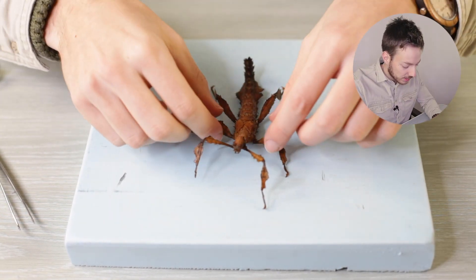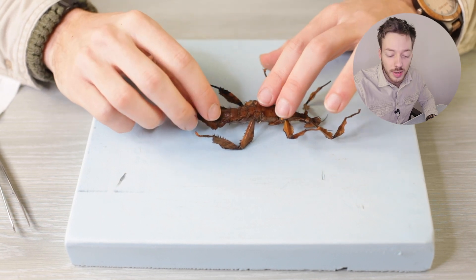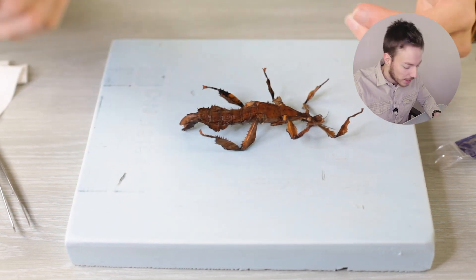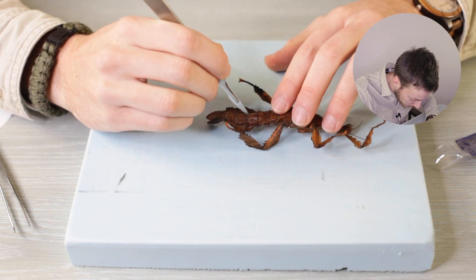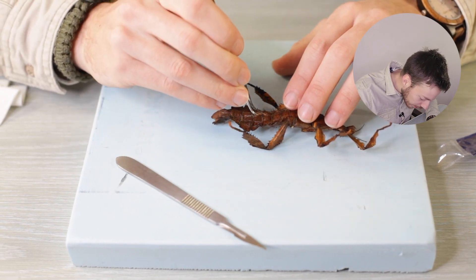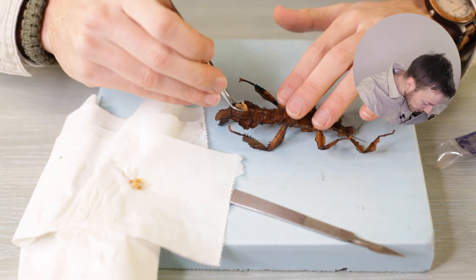First I want to take out the guts, because there might still be some food left in there. Even though it's been soaking in alcohol for a while, it could easily start rotting — and that's something we don't want. So I flip it over and cut through its belly. I've got this very sharp razor, specially made for dissecting animals, and I'm just cutting through — not going too far, just enough to get to the intestines. Then I'll use one of my curved pincers to get into its belly and take out all the stuff you don't want in there. You can see the alcohol has already done some of the work.